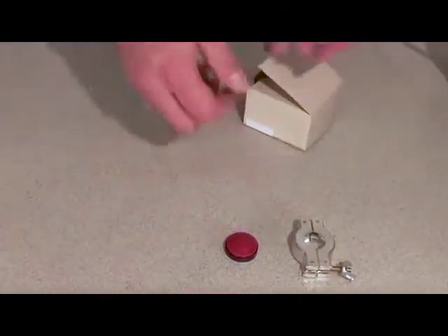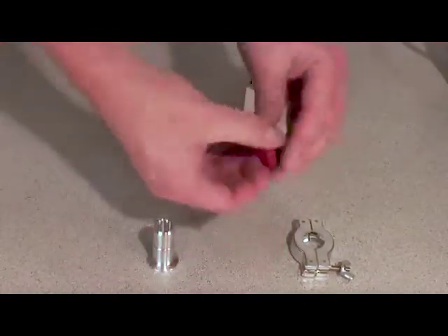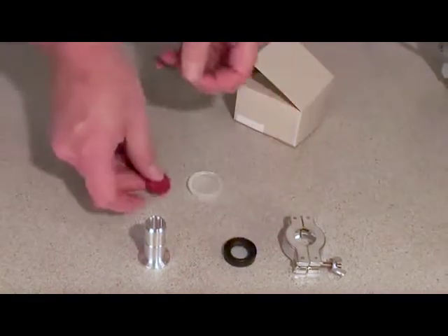Connect the three-quarter inch OD adapter using the clamps provided for connection to your equipment.